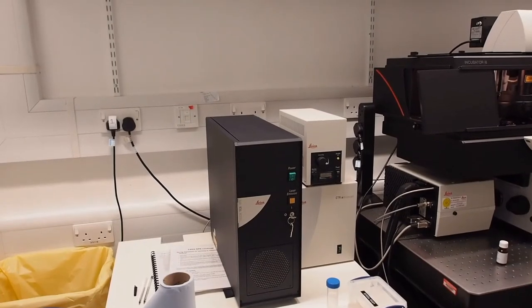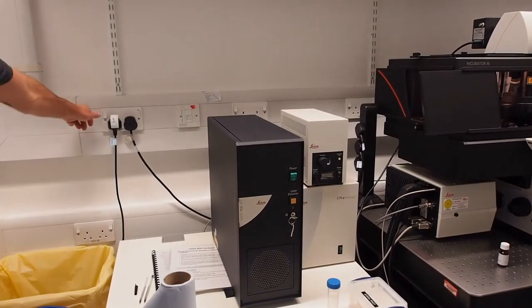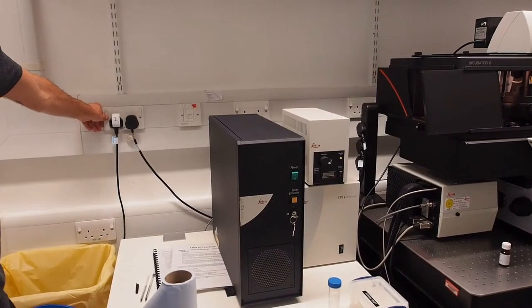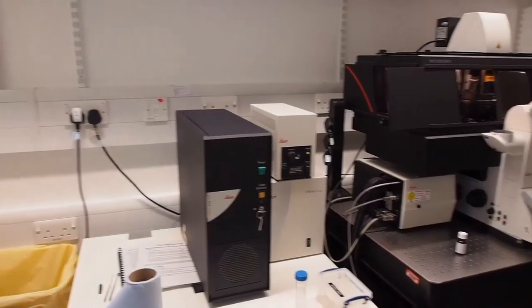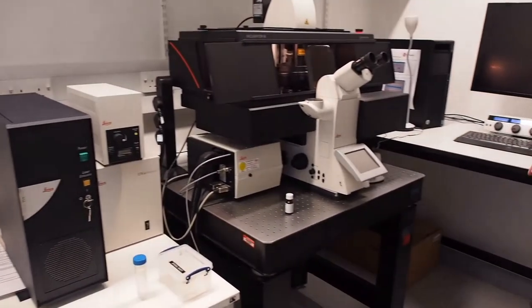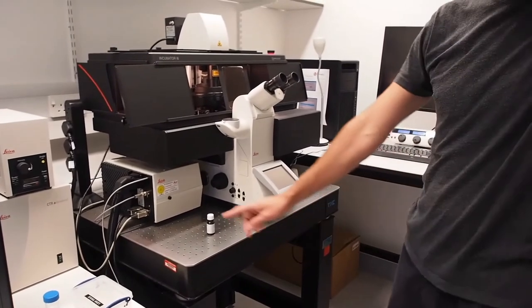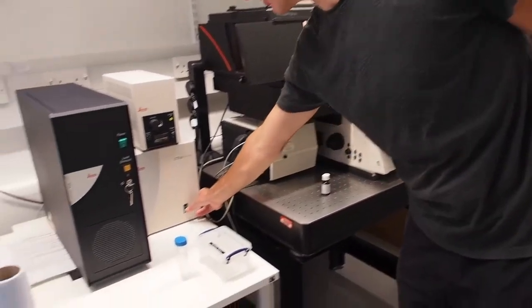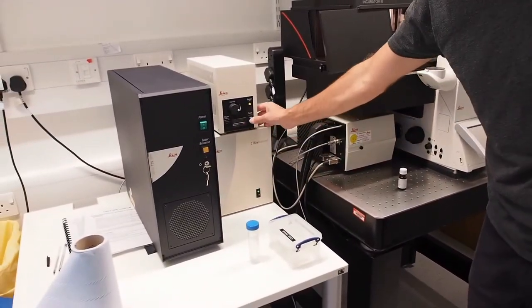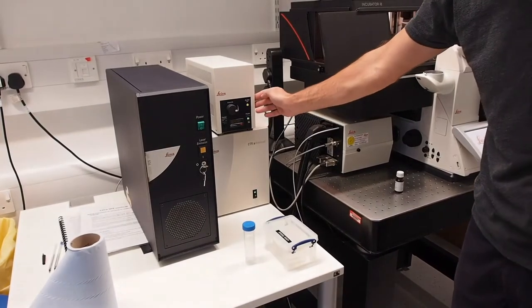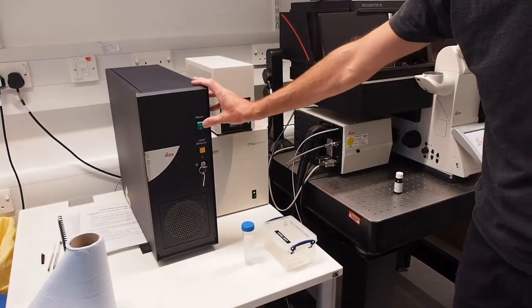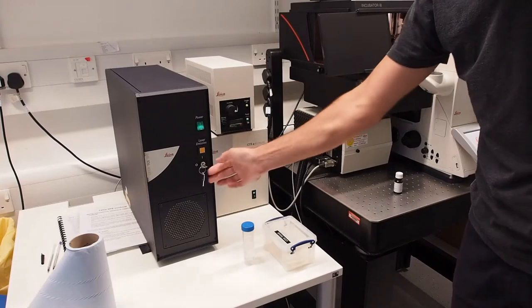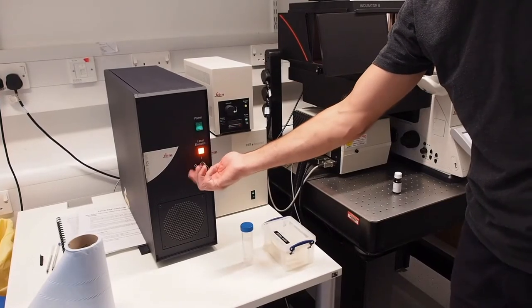First of all, turn on the wall plug numbered as 1, wait for the microscope to boot up and then switch on the CTR advanced box, the lamp and laser power and turn the laser key to on position.